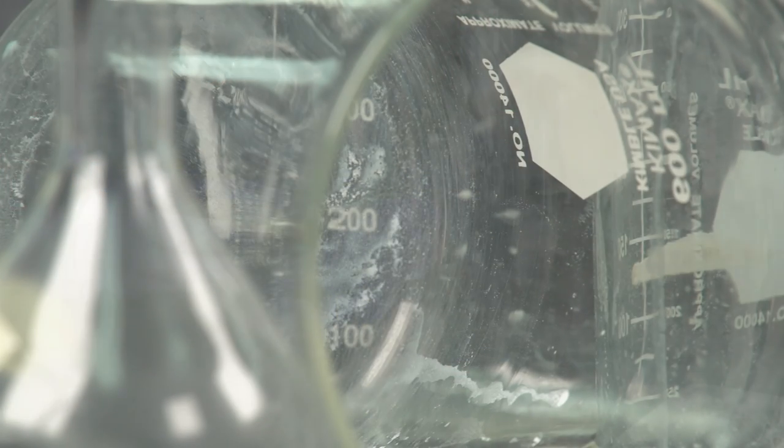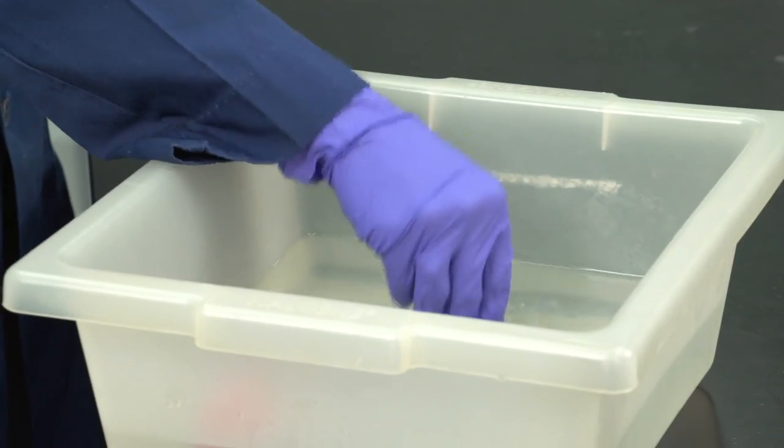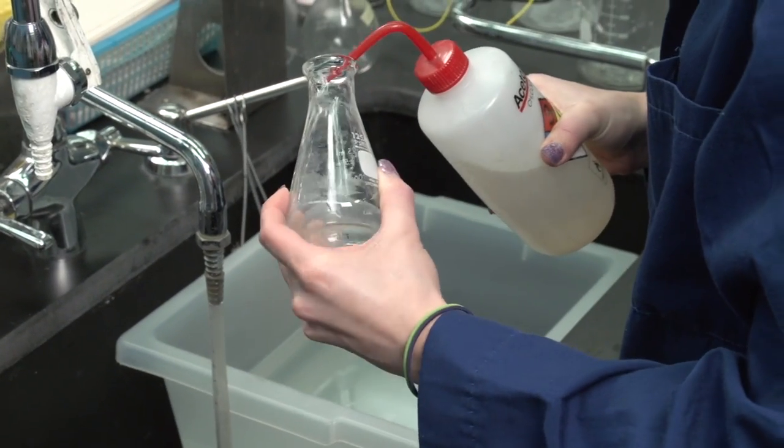Glassware contaminated with organic materials is soaked in sodium hydroxide or organic solvents such as acetone or methanol.